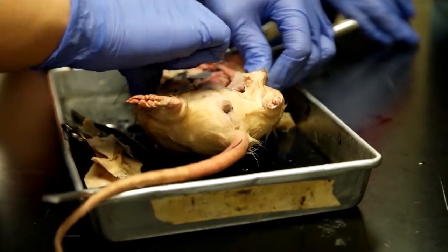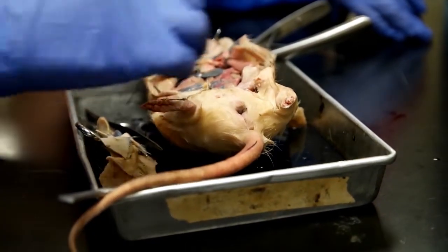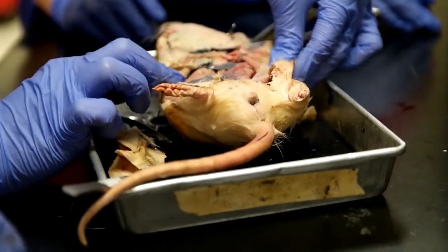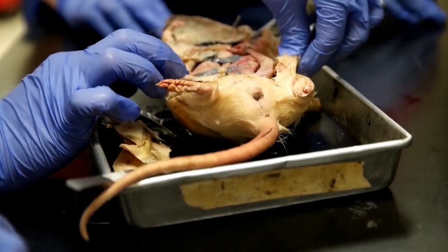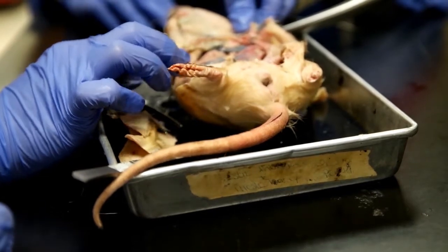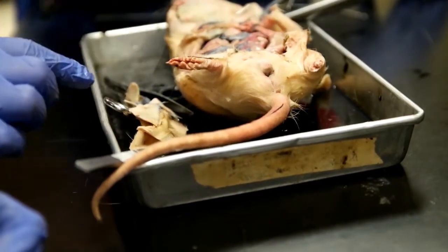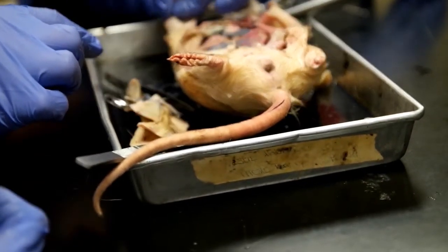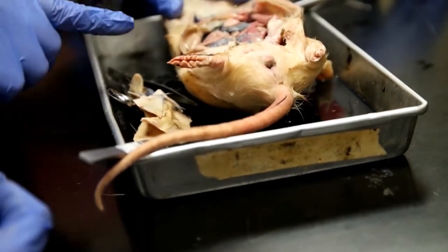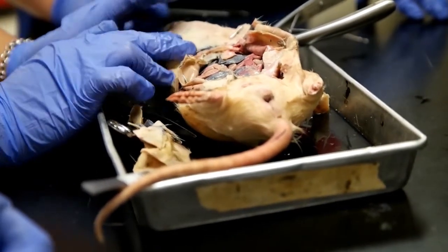You make an incision — yeah, you massage the rat and then... why? So you can find the extra skin it has, and then once you get that you can cut it and start taking off the skin slowly. Then once you have enough skin taken off, you can make a small incision where the muscles and tendons are and cut it open. Does it have to be in a particular direction — like a Y incision, vertical, or horizontal? I did horizontal. The rat can't really go that way.